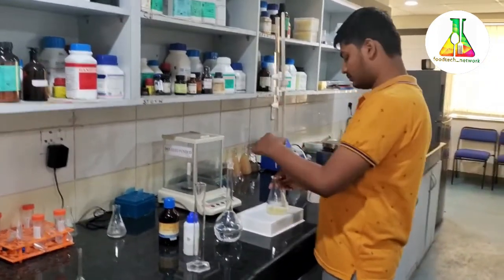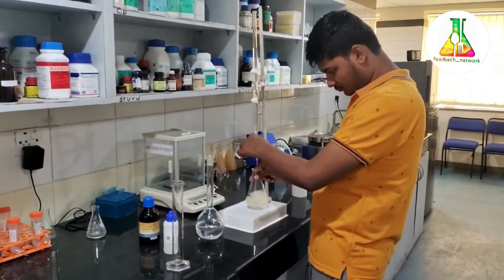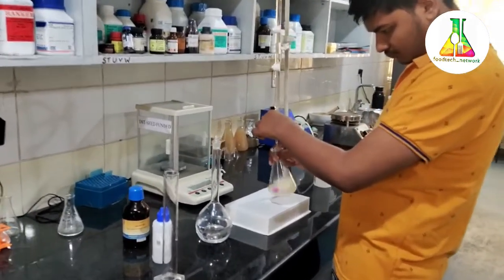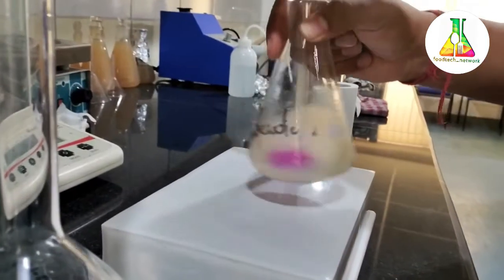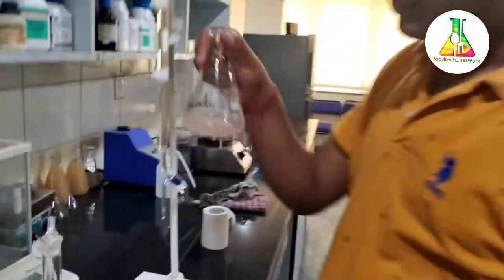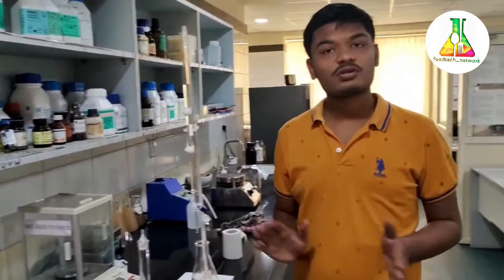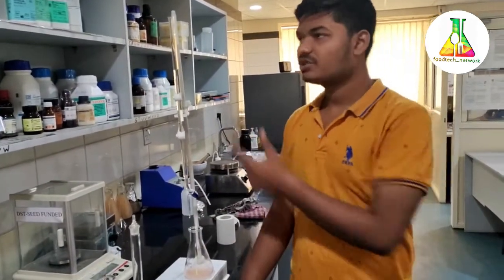We titrate it until a pale pink color is obtained. The initial reading is 1.8 ml. As you can see, it has developed a pale pink color, so this marks the end of our experiment. The standards for free fatty acid are 0.3% in case of ghee and 1% in case of olive oil. These values will be calculated using the titration readings obtained.